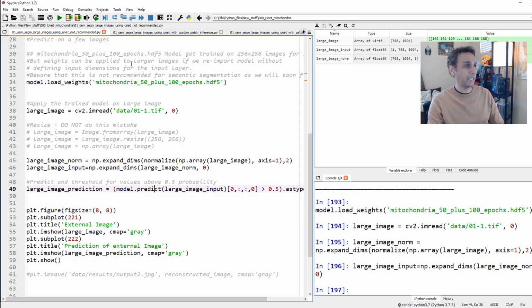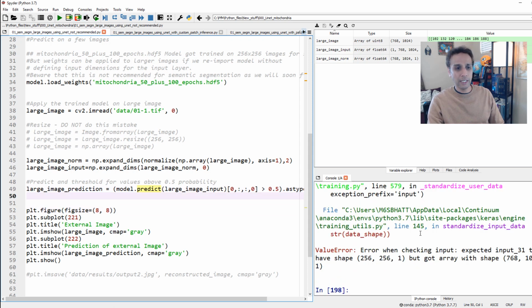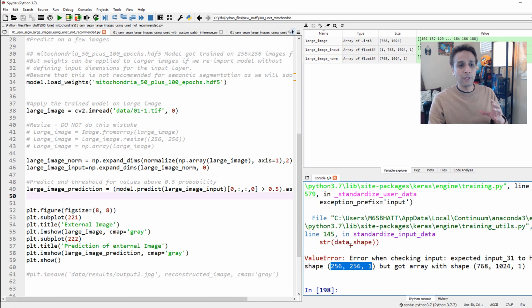So let's go ahead and predict this, and we should see an error right away down here saying that, hey, the input needs to be 256 by 256 by 1, but you gave me 768 by 1024 by 1. So I'm not gonna do anything here. This is a good thing. It's throwing us an error.